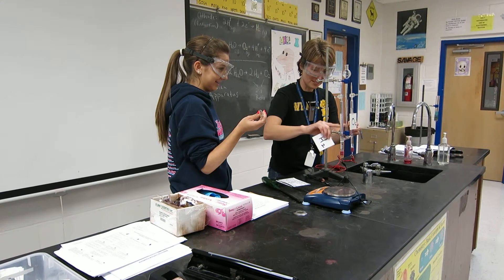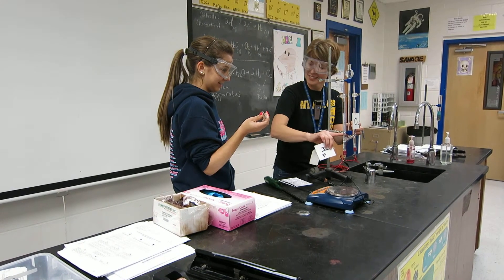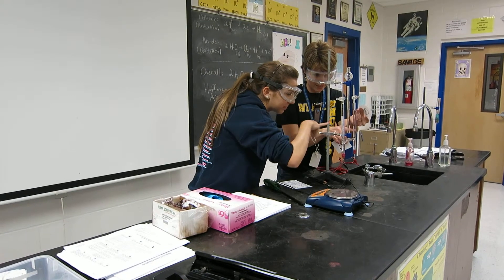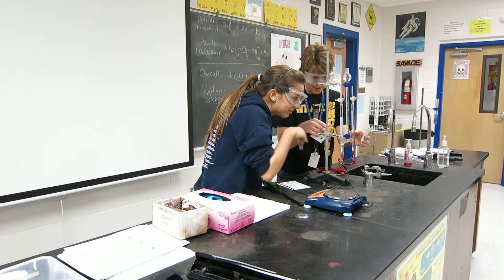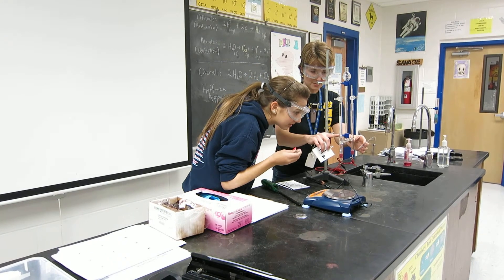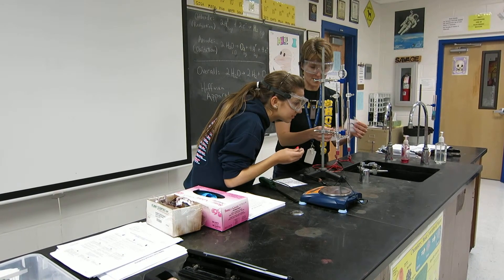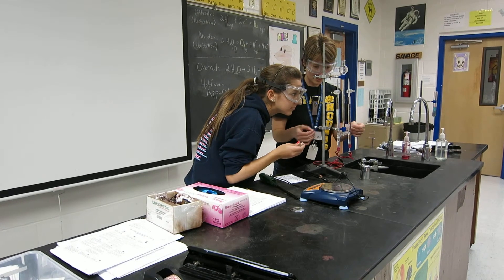You'll see why in just a minute. So you see the little bubbles? And you see how over here we have barely any. But those bubbles are bigger than these — these are like tiny bubbles. It looks like they're running about twice the rate over here.